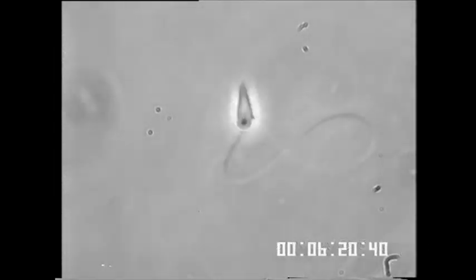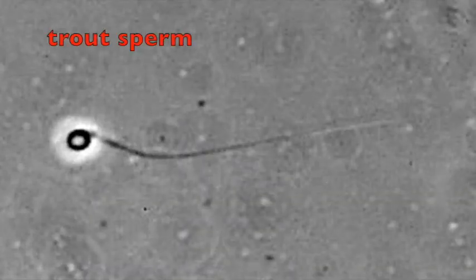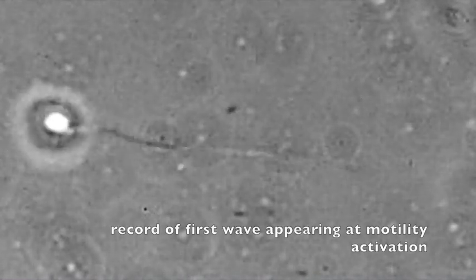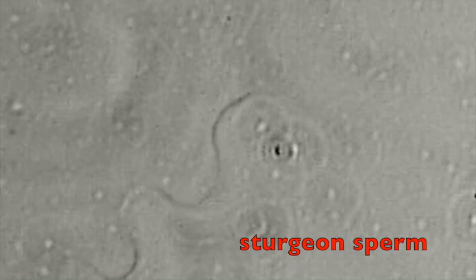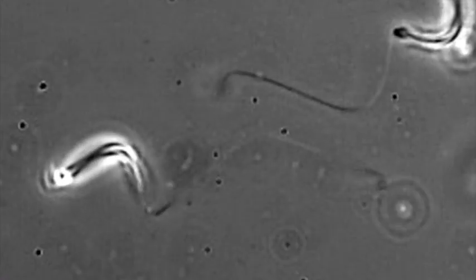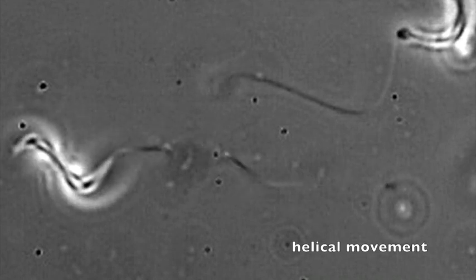Wave perturbations also appear in the flagellum of sturgeon sperm due to viscosity. Here is another example of information acquired at motility initiation of a trout spermatozoon, where the very initial waves could be recorded and quantified for the first time. Here are shown the movement characteristics of a headless sturgeon spermatozoon and another sperm cell devoid of membrane. A last example shows the propagation of helical waves in the flagellum of Xenopus spermatozoon.